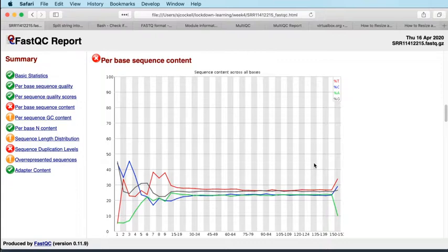So you'll see similar patterns of bias in modern bacterial genome sequencing experiments where the genome has been fragmented using tagmentation, so using an enzymatic process. You'll see a pattern of bias at the beginning of those reads as well. The same thing applies, those reads come from your genome, that's genomic DNA that you've sequenced. The enzymatic fragmentation has introduced a bias, but that's not a bias that we necessarily need to worry too much about. So this particular report in FastQC will very often fail. It's very rarely something you actually need to worry about.